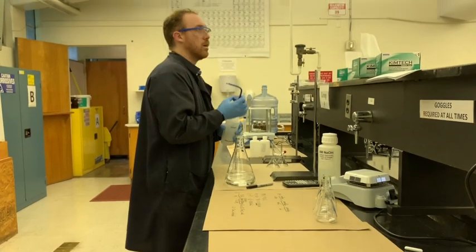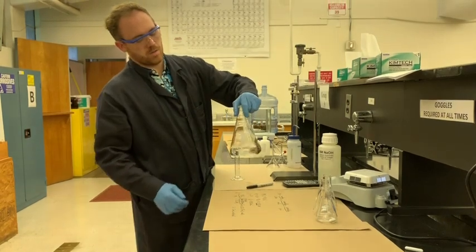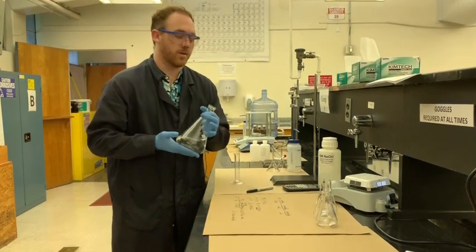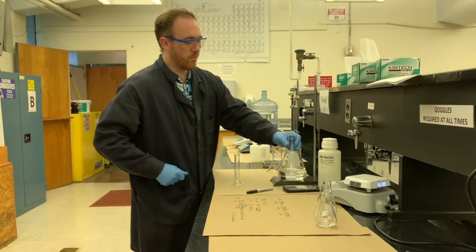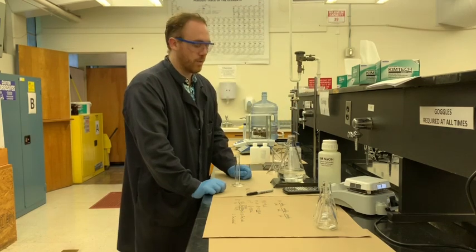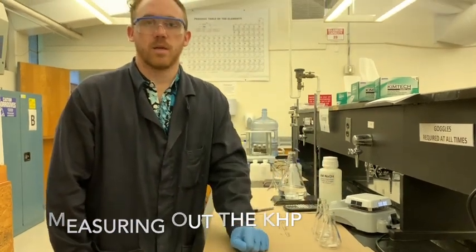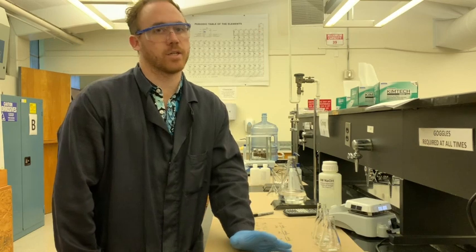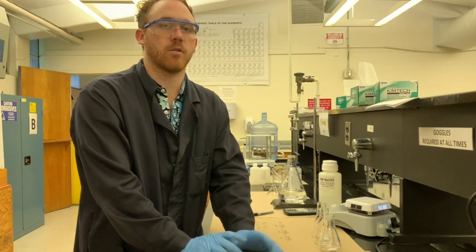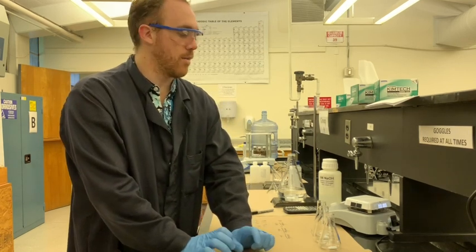So here we have our solution of NaOH, and this is what we're going to be using to do all of our titrating. So before we move forward, we're going to actually need to prepare our burette, and we're going to also need to prepare our KHP in our flasks. So KHP, we're going to be measuring out about 0.5 grams, and the key to making sure that we can carry precision in our calculations, that is to carefully measure out to as many significant figures as possible the mass of the KHP for each individual sample.